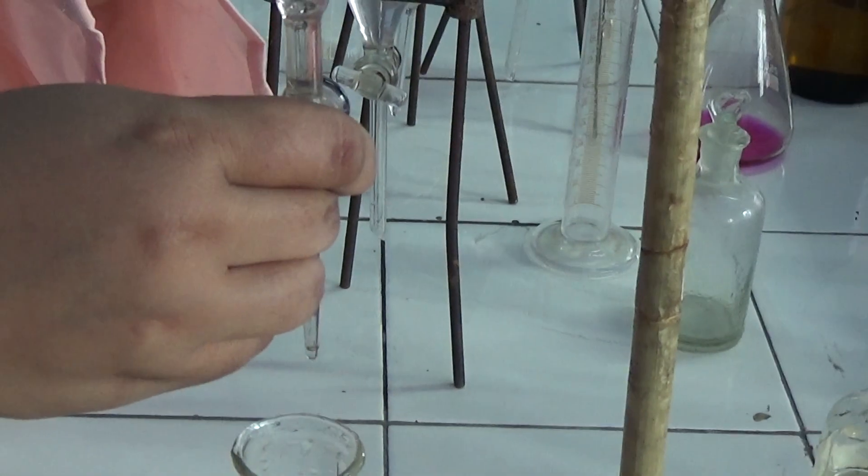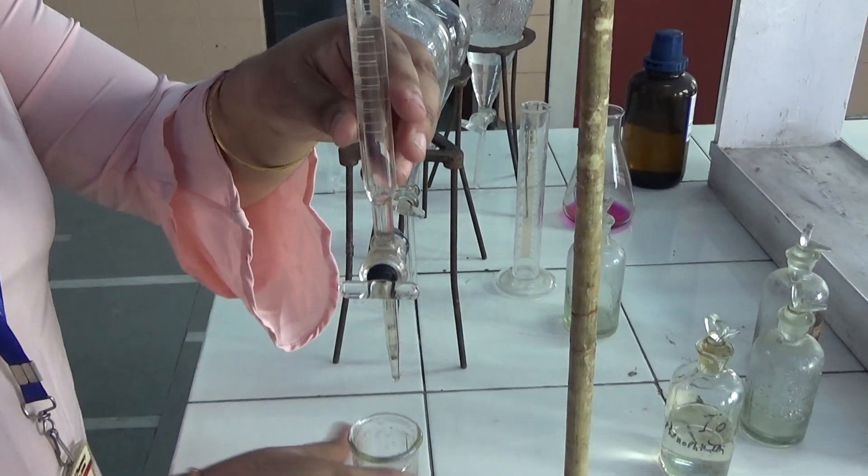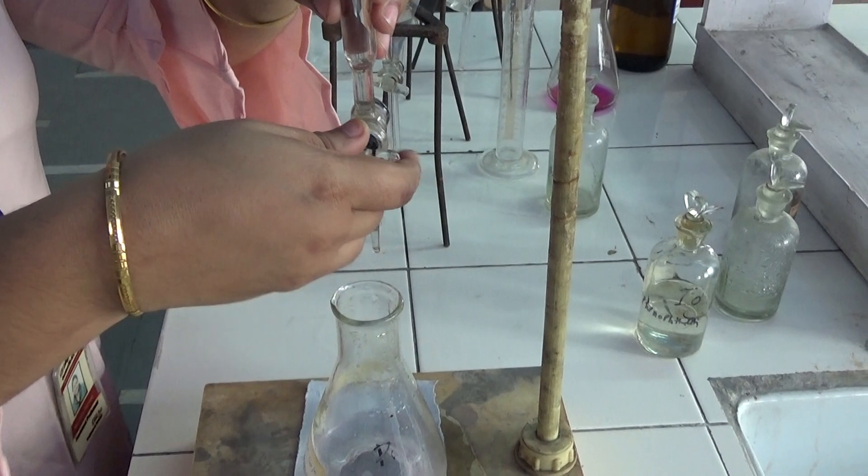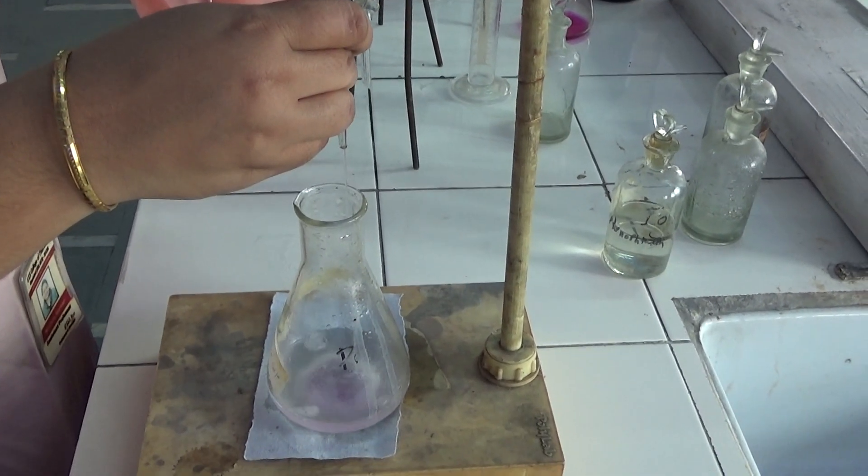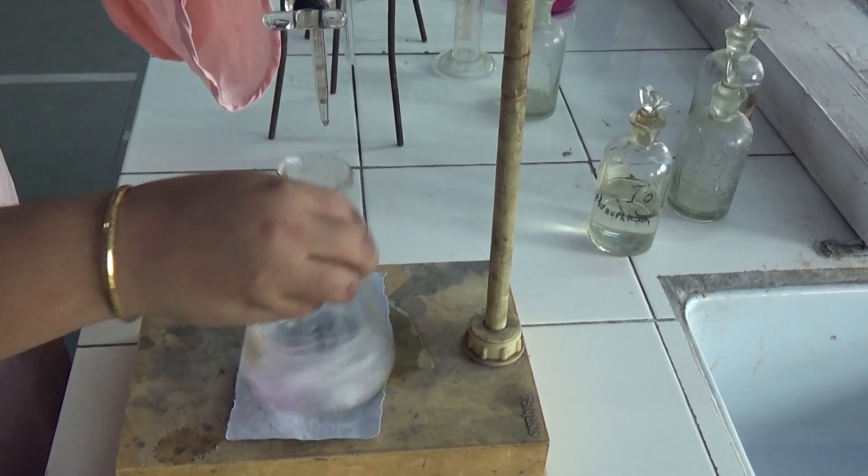As phenolphthalein will give a pale endpoint, the endpoint will be your pale pink color. The organic layer is more than enough.